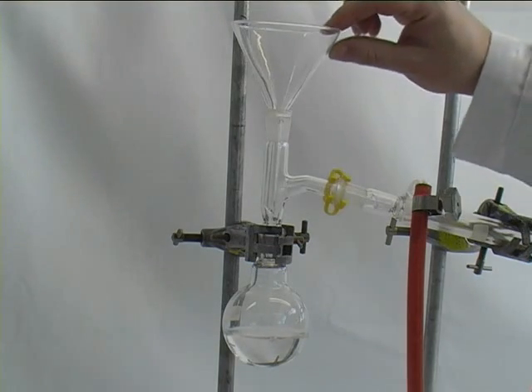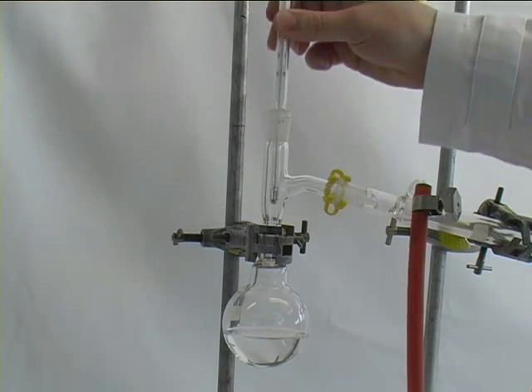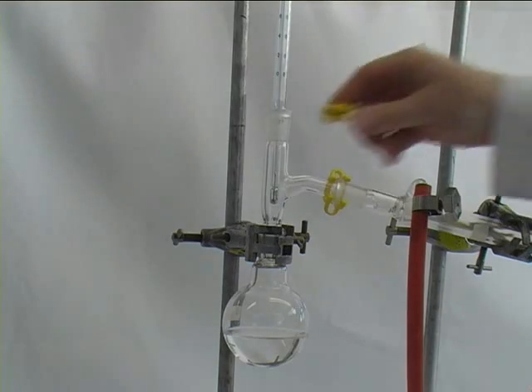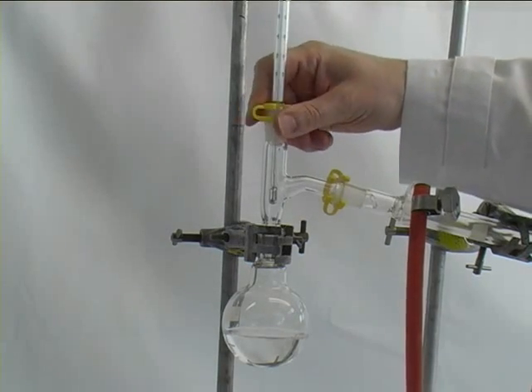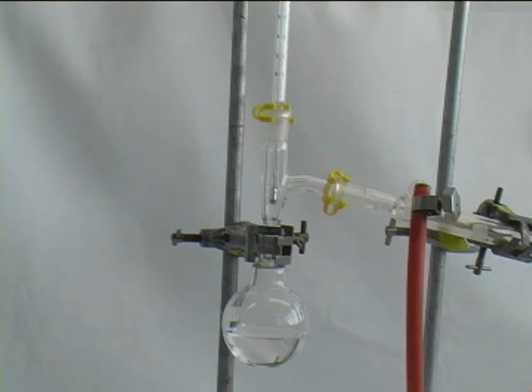Carefully remove the funnel, and finally carefully put the thermometer on top of the still head and fix it with a yellow joint clip. Before you start the distillation, ensure that the still head sits tightly on the round bottom flask, and there is no leak in between.